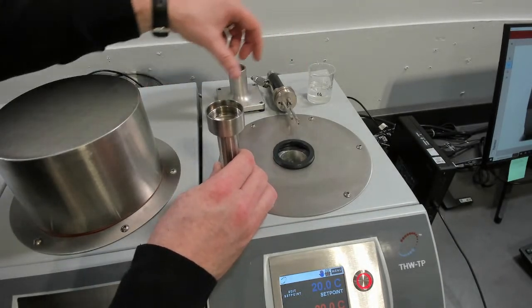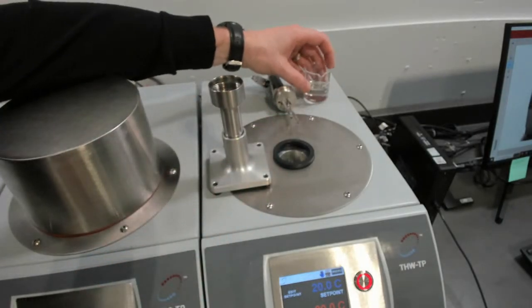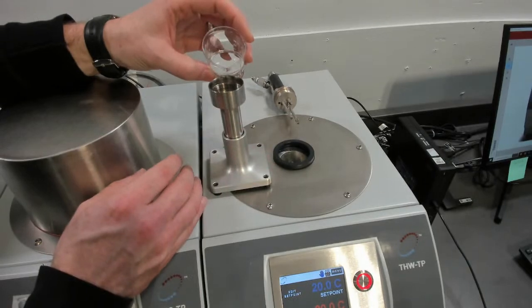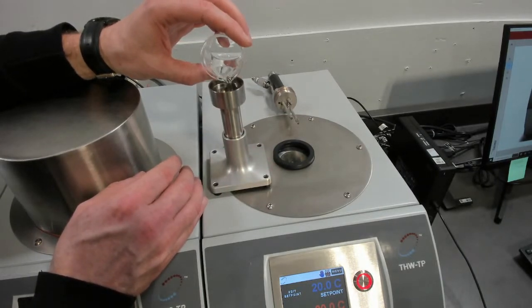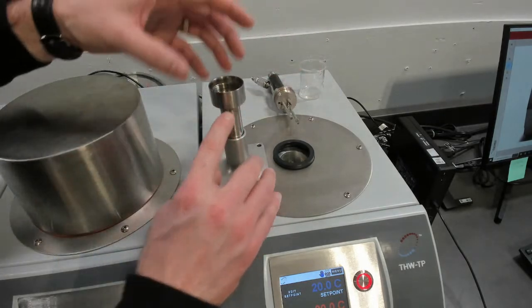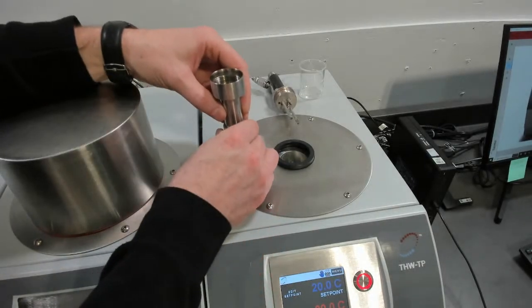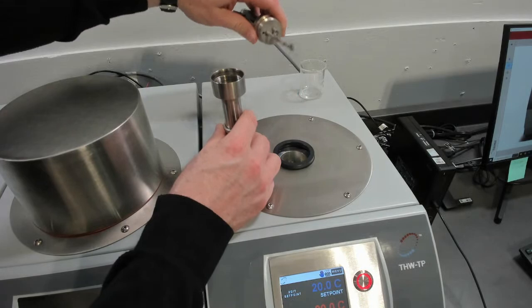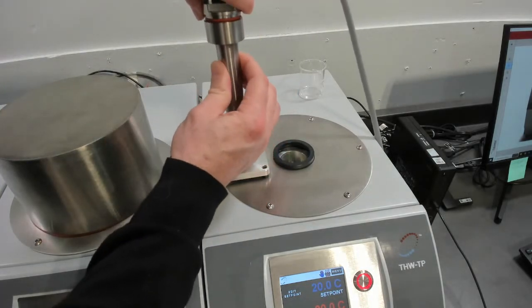So we're going to load, want to do this in front of the camera so you can sort of see the steps. We're going to load our ethylene glycol, which is, in this case, about 20 milliliters. So I basically load it until it is near the top of the cell. And we're going to put our sensor in here. I'm just going to lift this out, turn it.